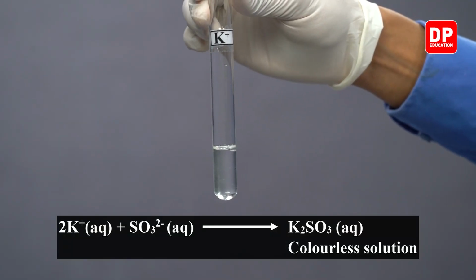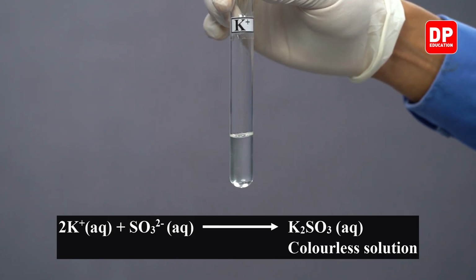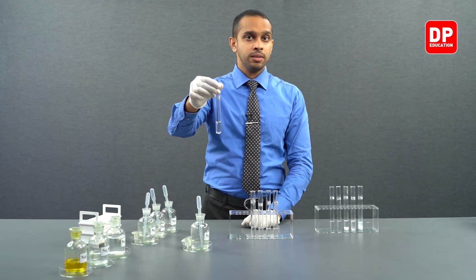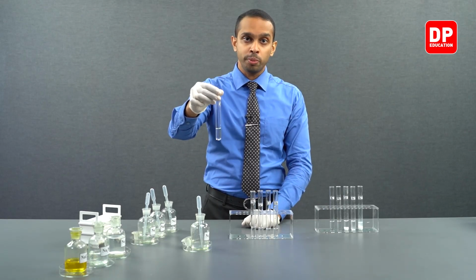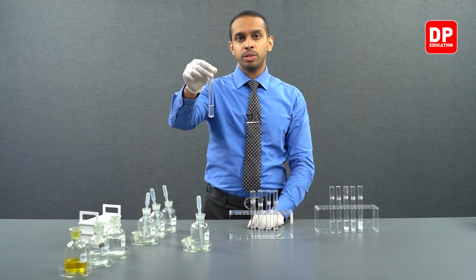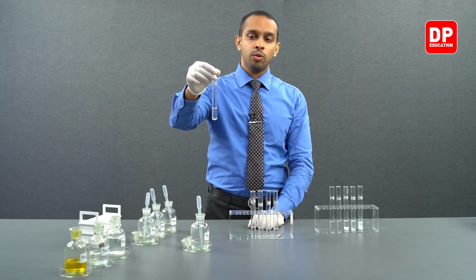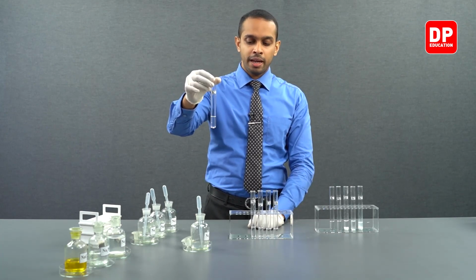Potassium 1 plus ions, when in presence of sulfite anion, will form potassium sulfite. Potassium sulfite is a salt that is soluble in water. So therefore, you will see that this solution is not producing a precipitate. There will be no precipitate present when reacting potassium ions with sulfite anion.